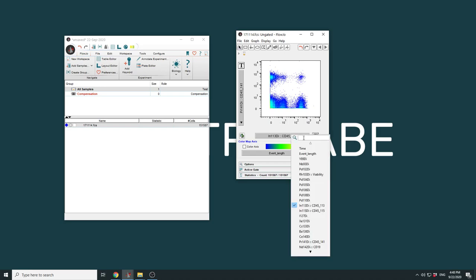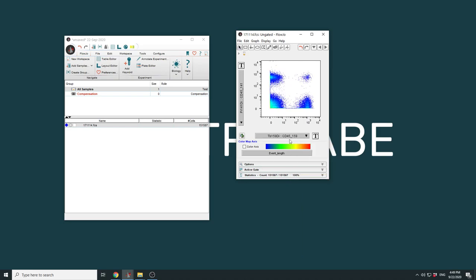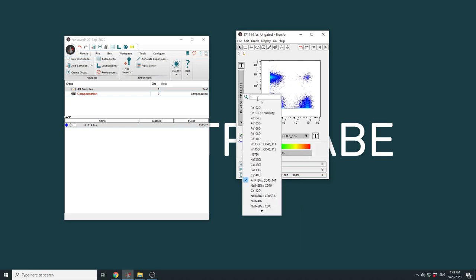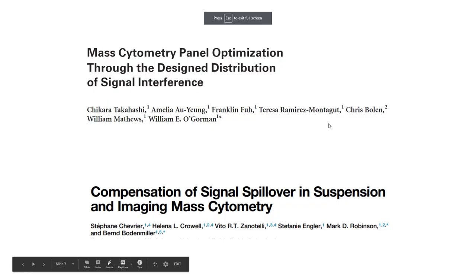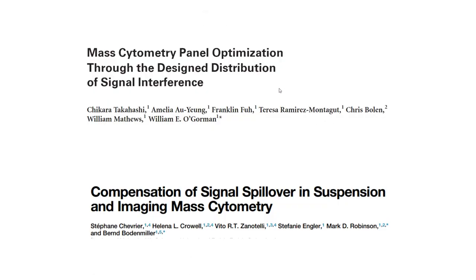Let's have a quick look at 159 versus 175. And although the spillover here is not as bad as before, you can still see that the negative on 175 is influenced by 159, and you can see a bit of a correlation between these two channels. Thankfully, both of these papers include suggestions and methodologies to deal with spillover.